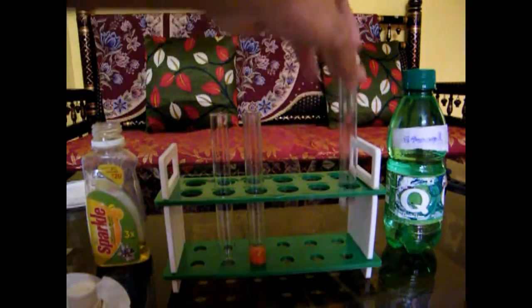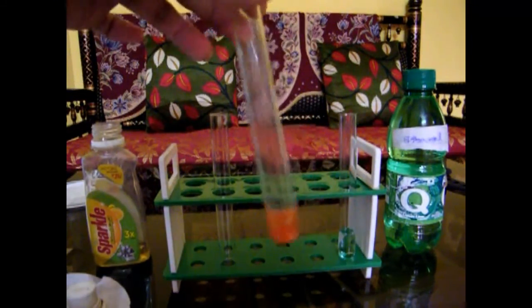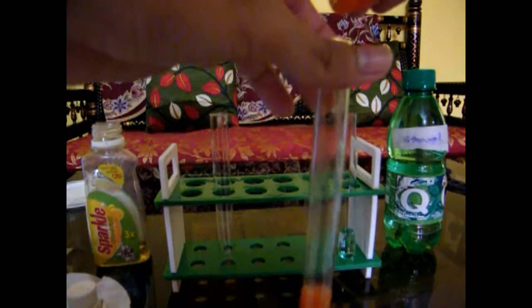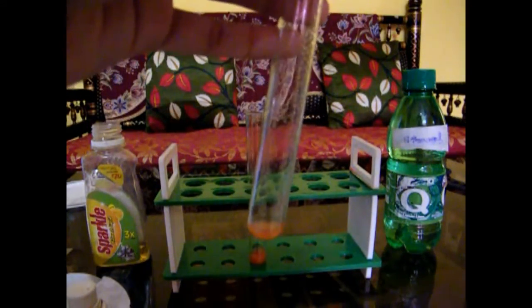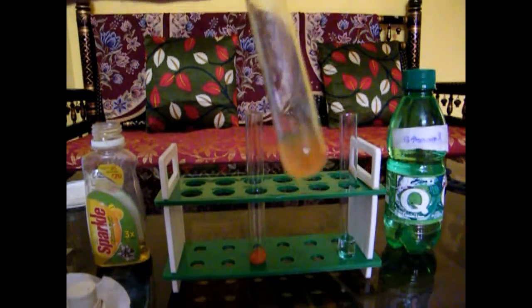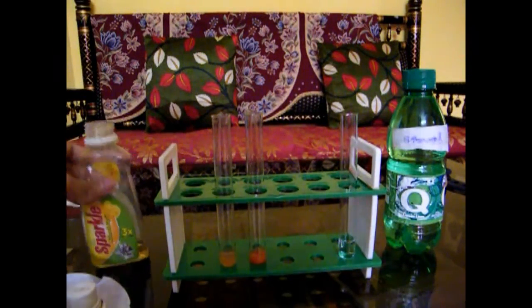For the first part, I have distilled water here in a small amount. I have extracted some tomato juice — I have this cut piece of tomato and used a simple way of dropping the tomato juice. Now we are going to use a little bit of distilled water to dilute it, so the solution is ready.